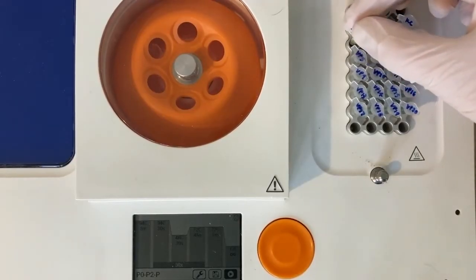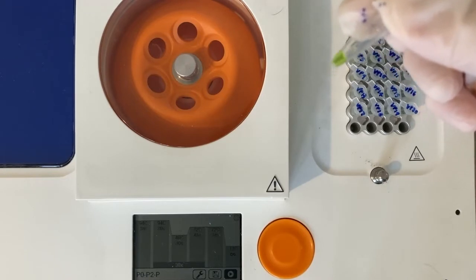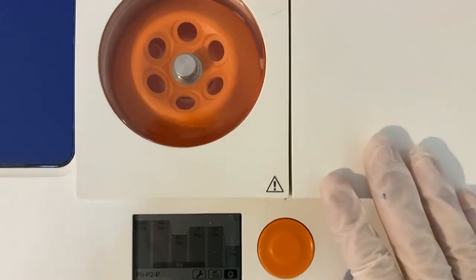I've set up all the samples in the master mix, which contains the polymerase, water, primers, and DNA. Now I'm going to run the PCR. The reason this one is customized for pigeons is the primer mix, which is currently not available on our website but hopefully will be if today goes well. There's a key temperature in the PCR cycles called the annealing temperature — pigeons for some reason require a much lower annealing temperature than other birds. 55°C is the most common temperature for avian sexing, but I've lowered it to 48°C here for pigeons, with 30 cycles.